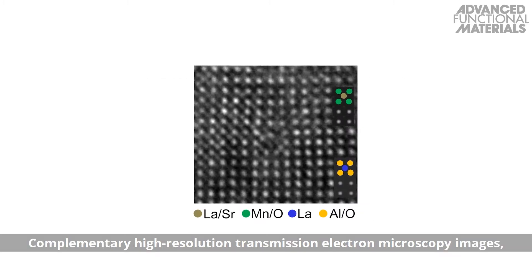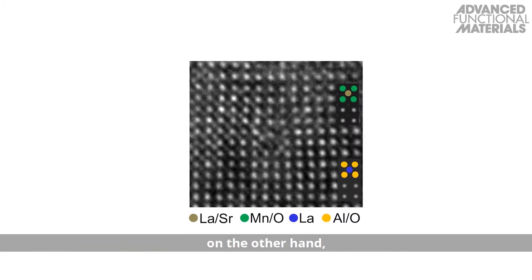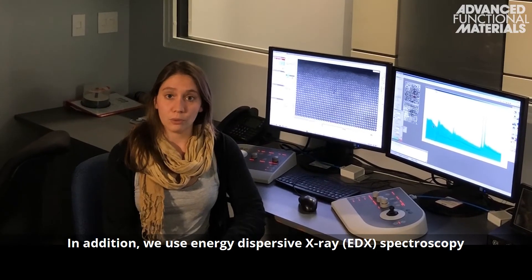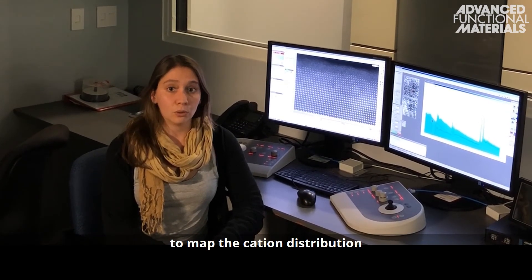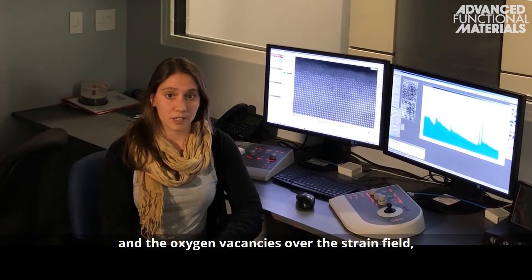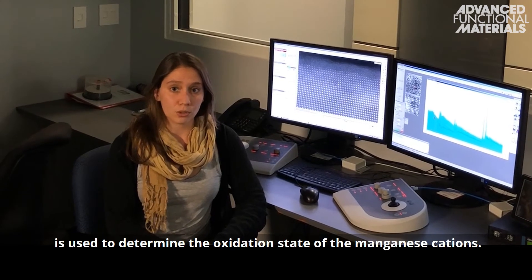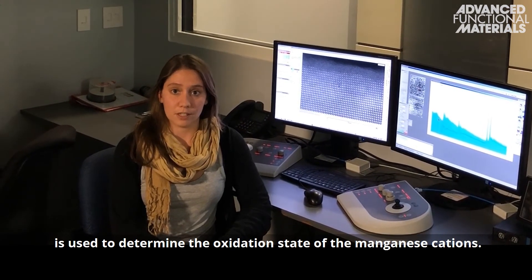Complementary high resolution transmission electron microscopy images, on the other hand, are used to map the dislocation strain field. In addition, we use energy dispersive x-ray spectroscopy to map the cation distribution and the oxygen vacancies over the strain field, and electron energy loss spectroscopy is used to determine the oxidation state of the manganese cations.